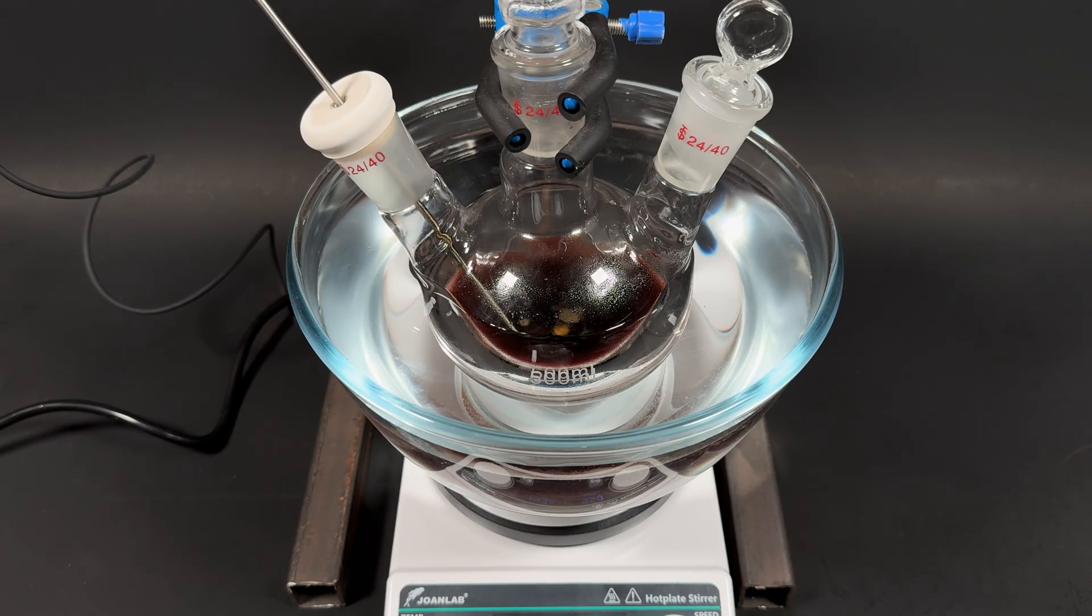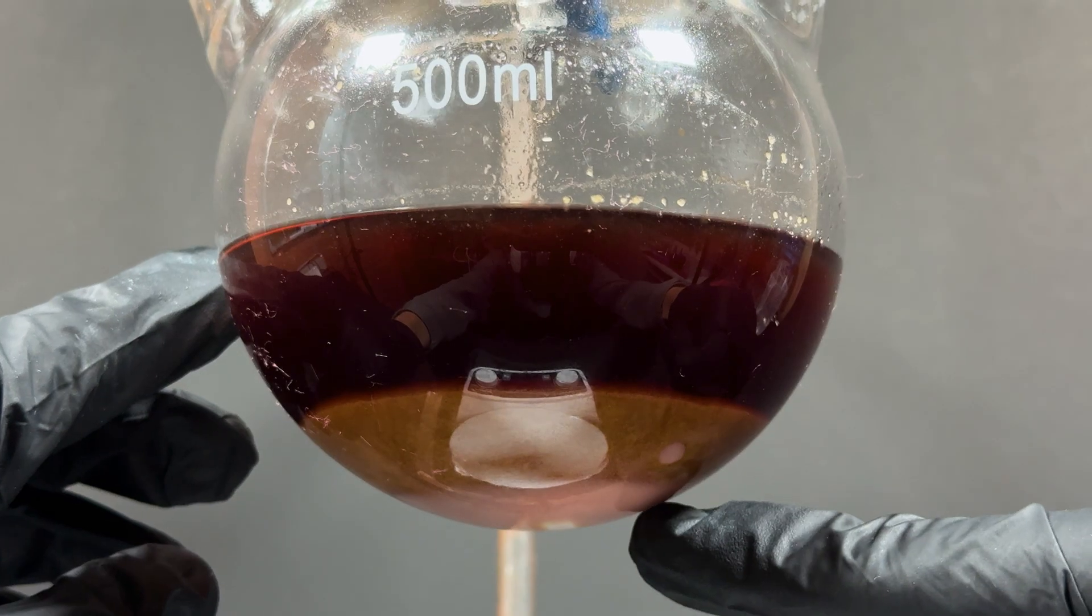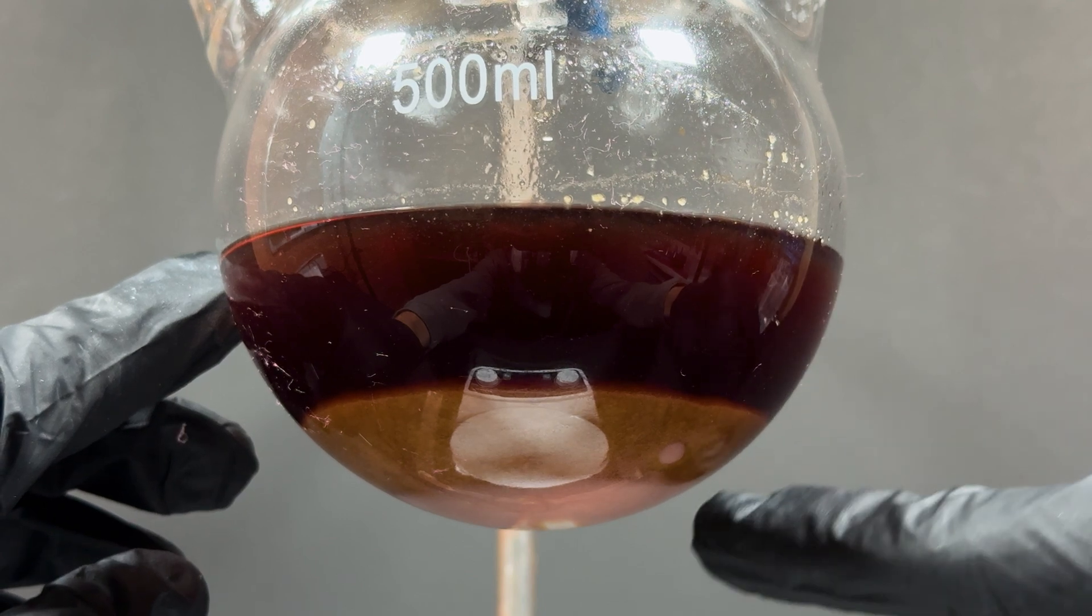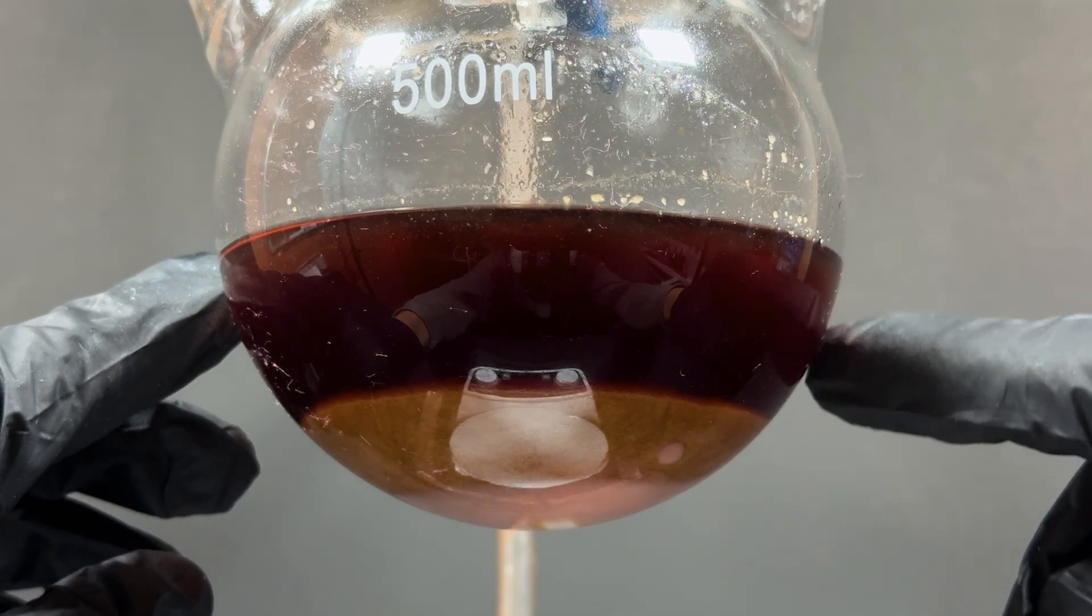When I came back, the flask looked like cherry juice. Some powder was floating at the bottom, which is good. It's a mix of our product and some inorganic salts.